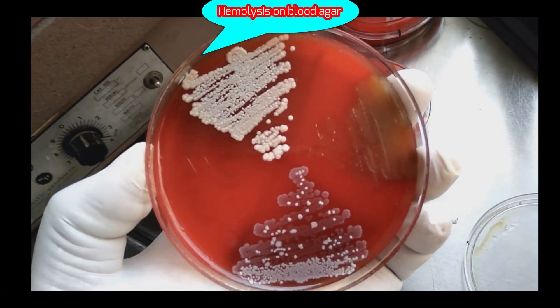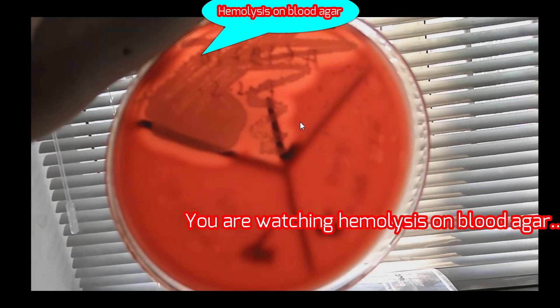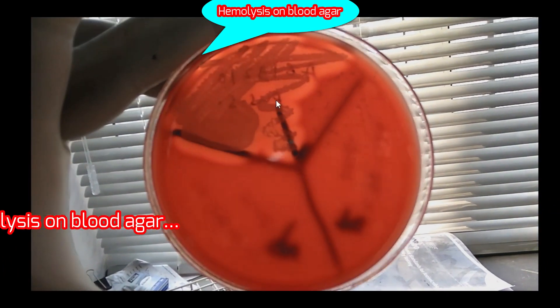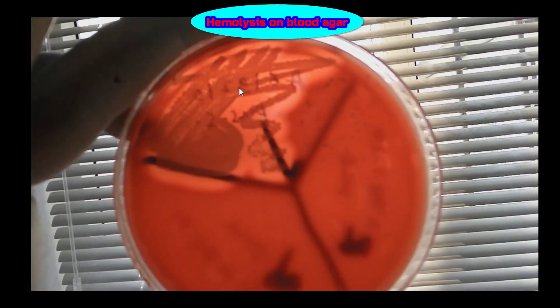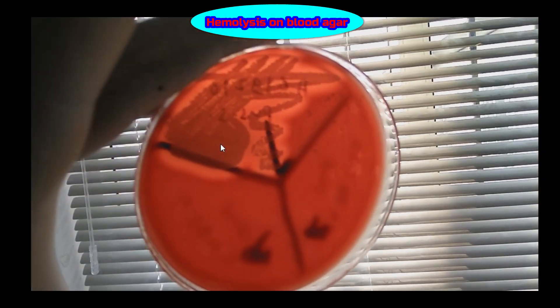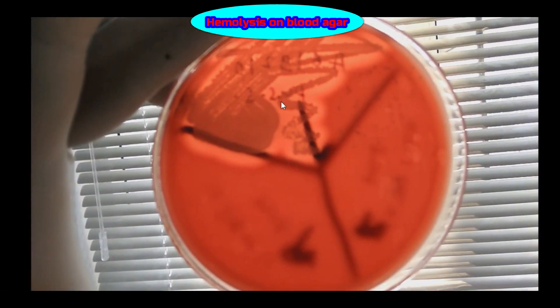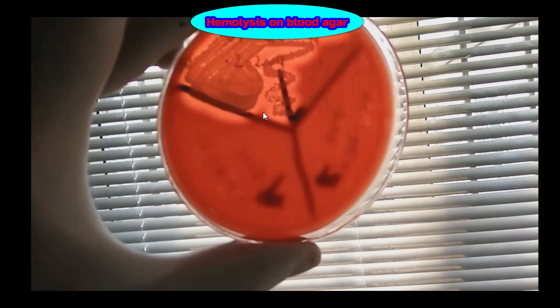In this region you can see alpha hemolytic colonies, and here you can see the beta hemolytic colonies — what beautiful beta hemolytic colonies!